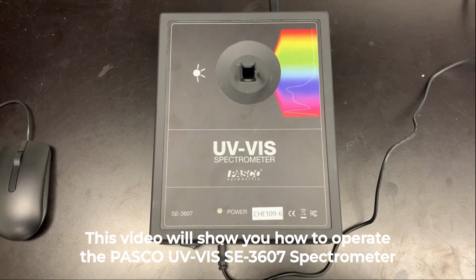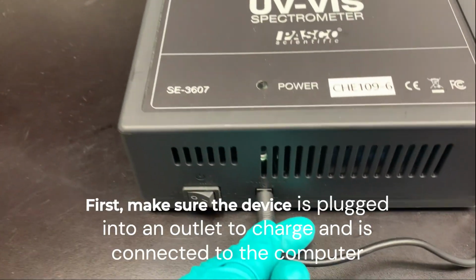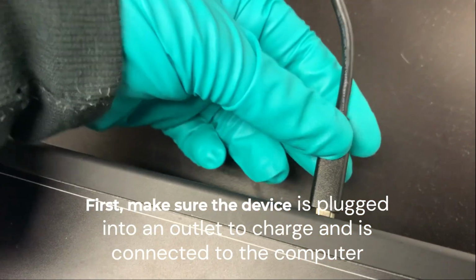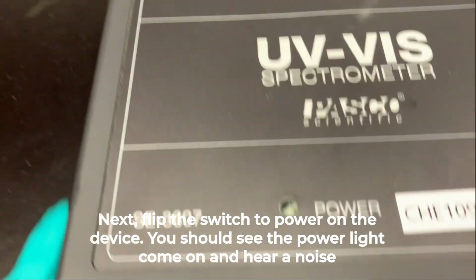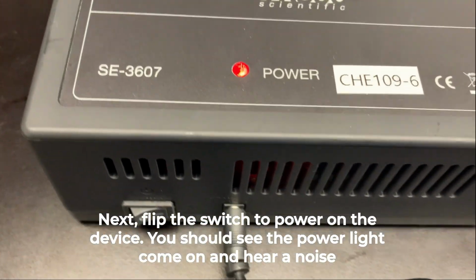This video will show you how to operate the PASCO UV-Vis Spectrometer. First, make sure the device is plugged into an outlet to charge and is connected to the computer. Next, flip the switch to power on the device. You should see the power light come on and hear a noise.